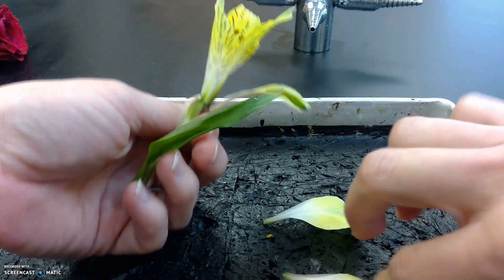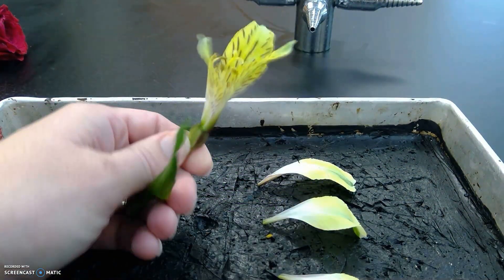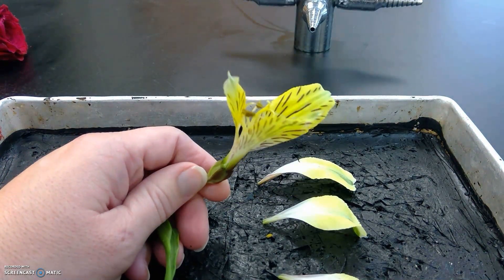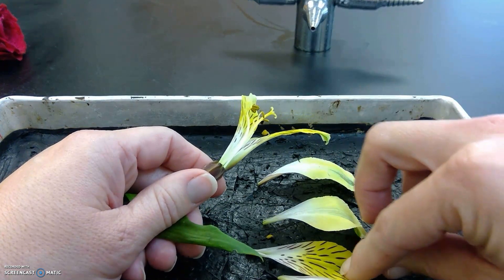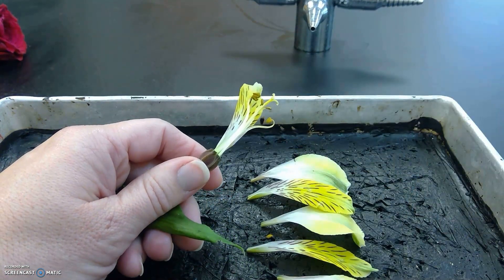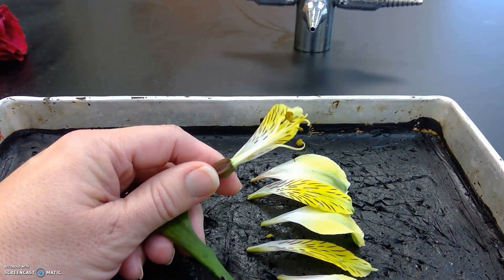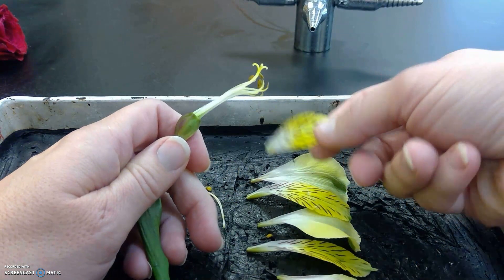The inside part is actually the flower, and again it's in threes. What I wanted to show is some of the male and female parts. So I'm going to go ahead and take off the petals now. The purpose of a petal is to attract pollinators to come and help reproduce here.